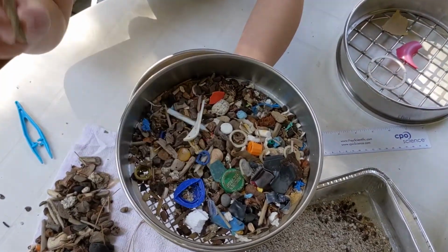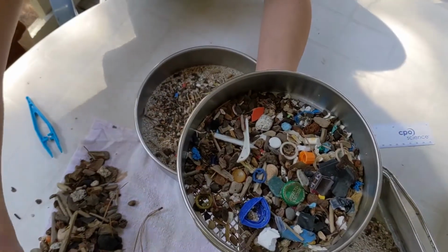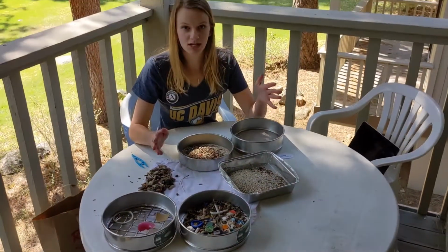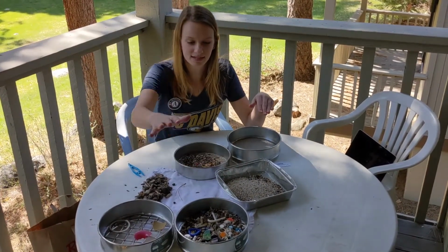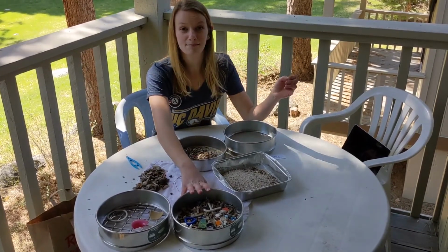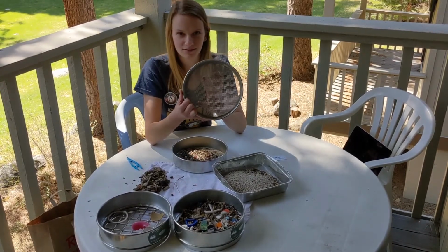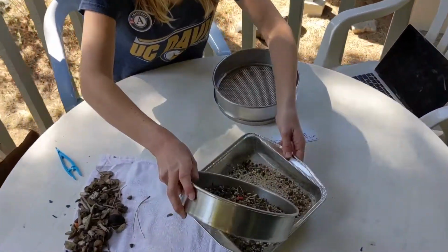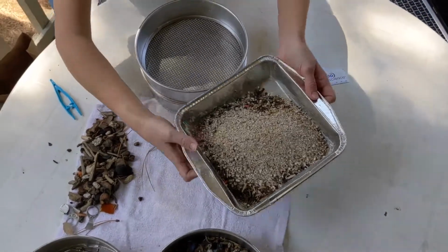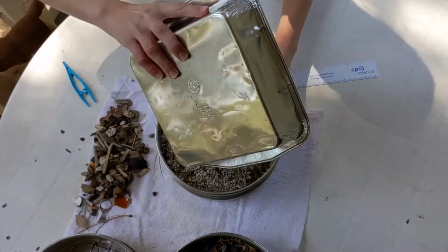As you can see, we've missed some of our organic material, so we can go back through and collect those later. But now we've got our macroplastics, our mesoplastics, and then we're going to do one final sieve to catch our microplastics. We said that microplastics are anything smaller than 5 millimeters, so anything that fell through this sieve should be considered a microplastic. And to catch those and to observe them a little clearer, we're going to use a 2 millimeter mesh sieve. So I am going to reintroduce those so we can use this base because that was a lot easier. And we'll pour our sand and tiny plastics through our final sieve.